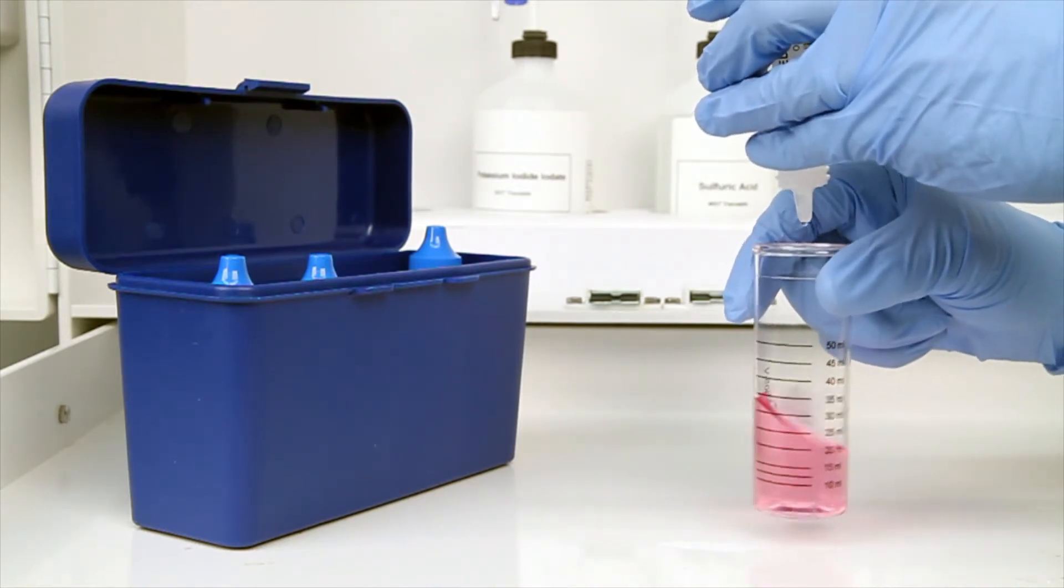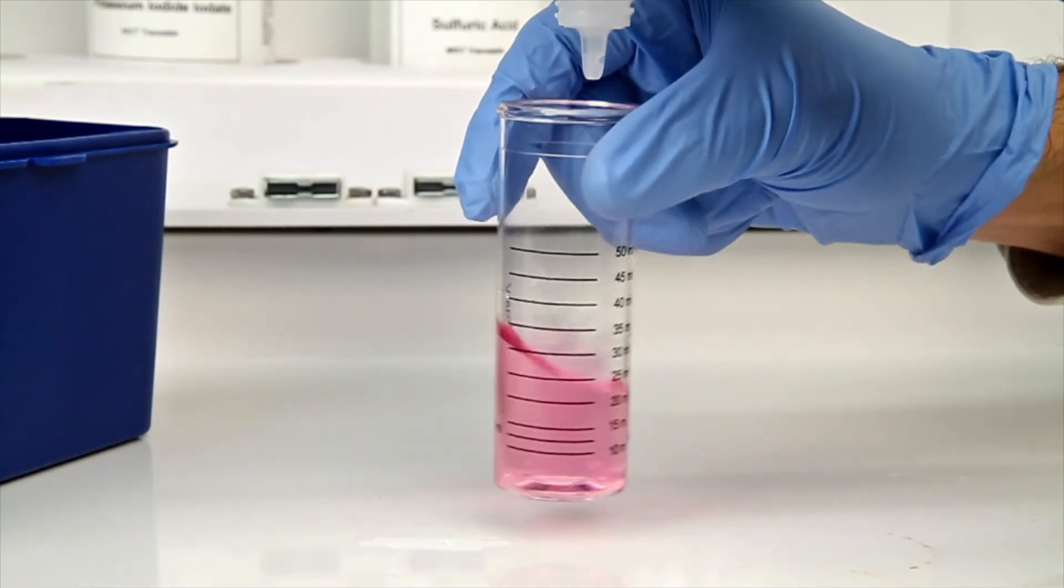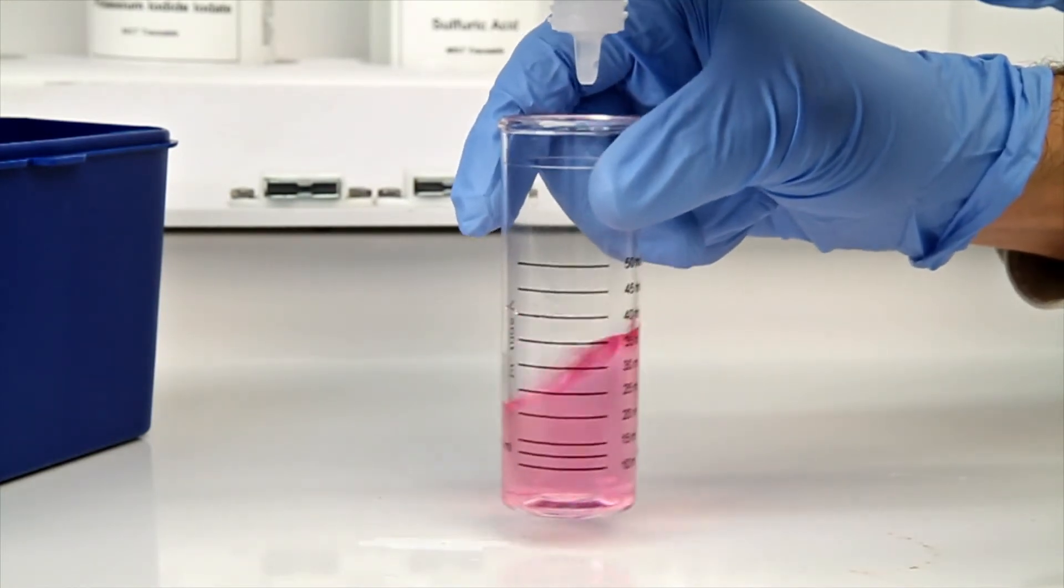Be sure to hold the bottle vertically to get a consistent drop size. After the addition of each drop of titrant, you want to swirl the vial to make sure the sample is properly mixed.